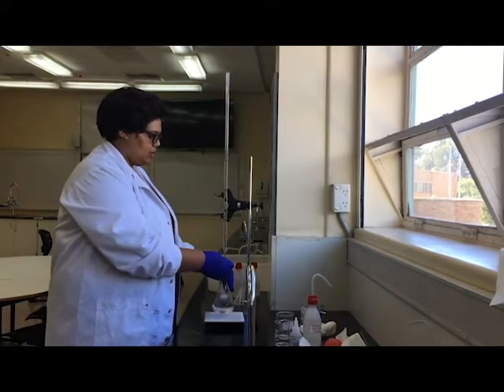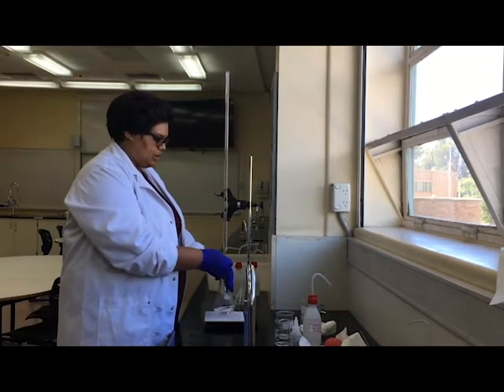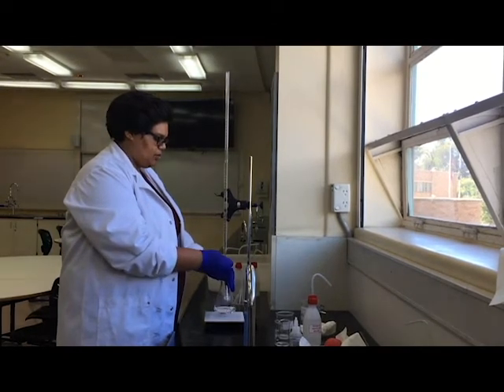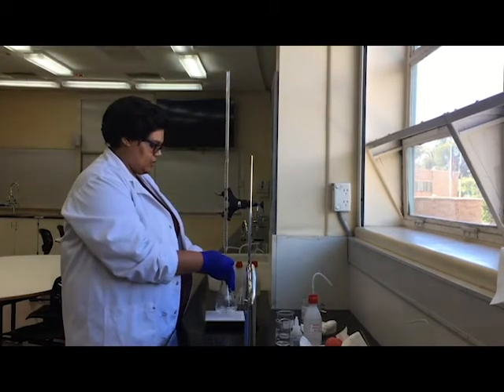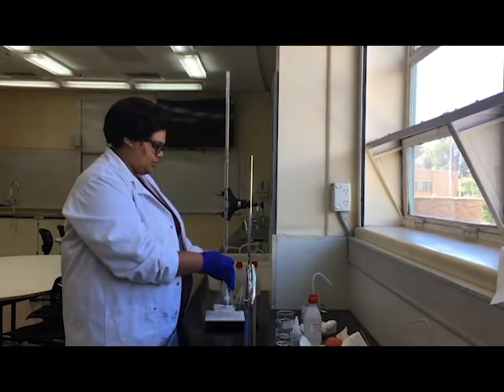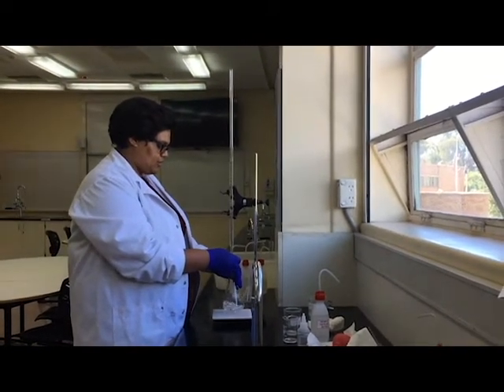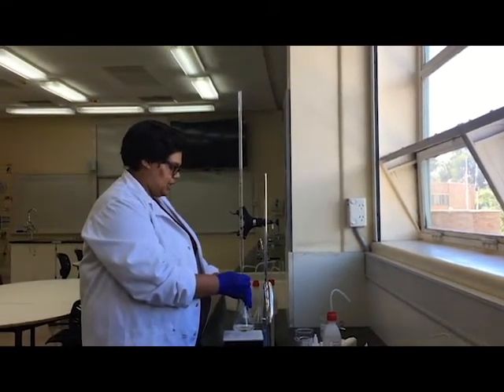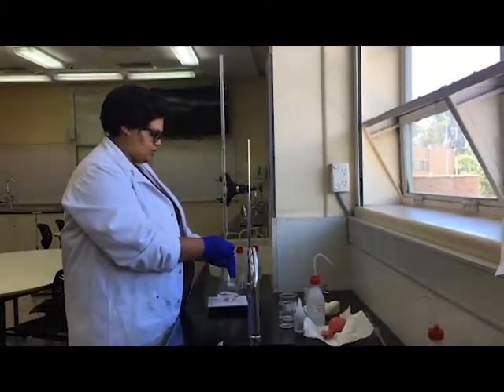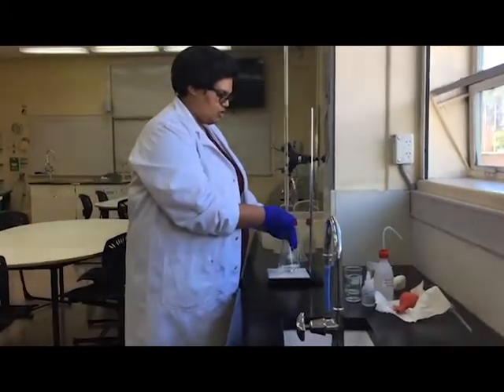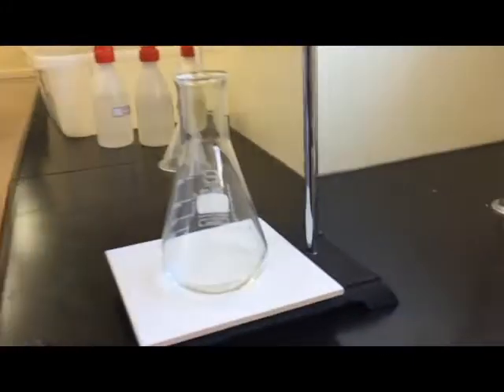So now that I've gotten a lot closer, I want to just do a little bit at a time. I don't really want to go over. I want a really nice pale pink color. So now I'm only putting a few drops in because I'm trying to get it as close to pale pink as possible. Let me move this up a little bit.